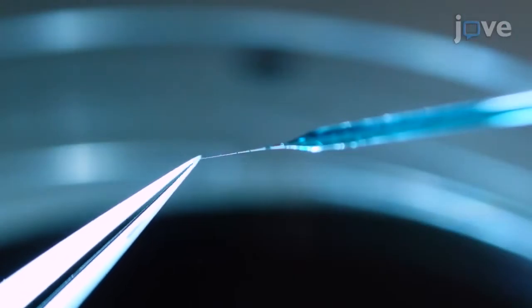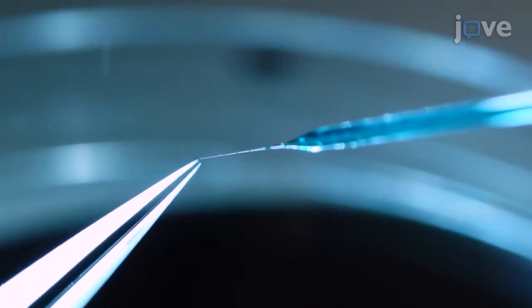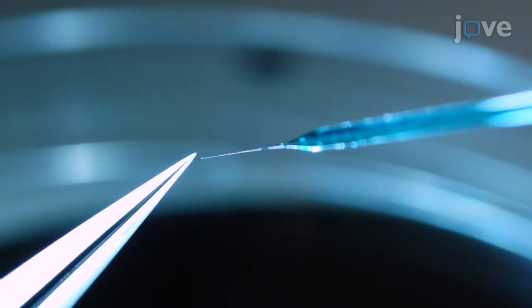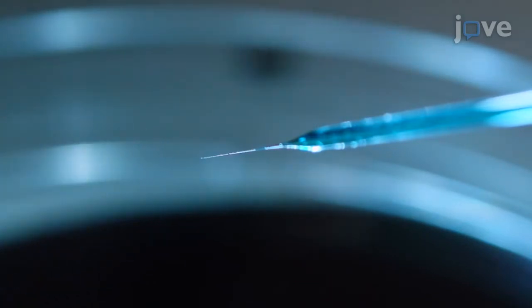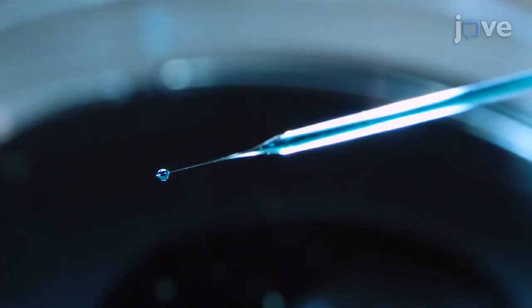Then, using a stereo microscope with 4x magnification and fine-end forceps, cut only the tip of the capillary, then apply pressure to the foot pedal to confirm that the plasmid solution runs easily out of the needle without hindrance.